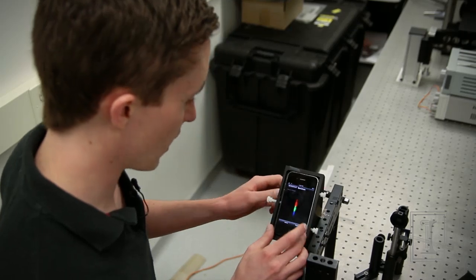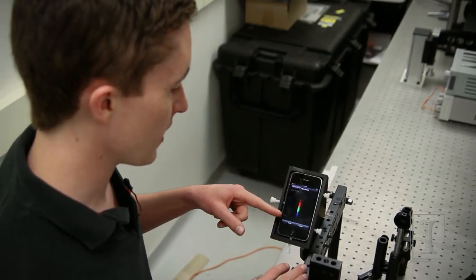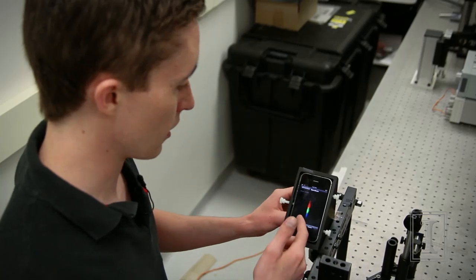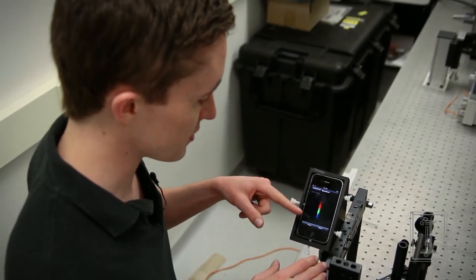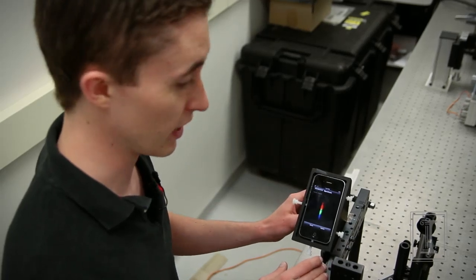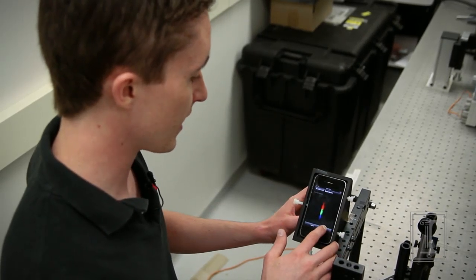So here we have a little black bar and this is essentially a location along the spectrum at which our sensor is resonant at, and depending on where that black bar moves up and down the spectrum that correlates to a change in color, which is essentially what we're measuring. So we can go ahead and capture our data right now.